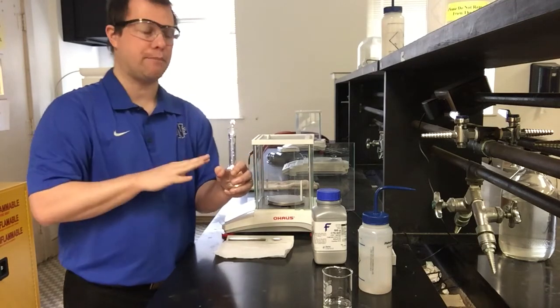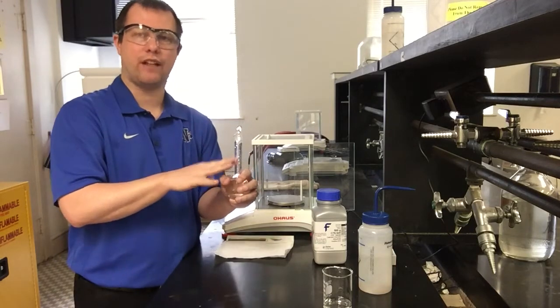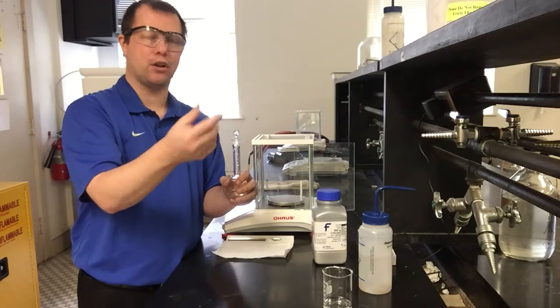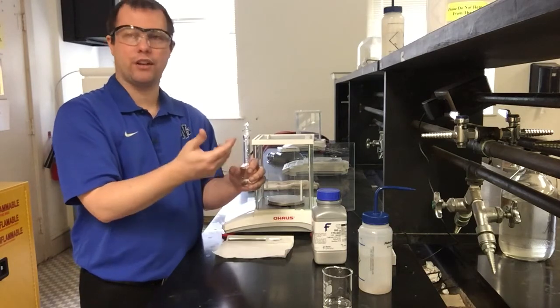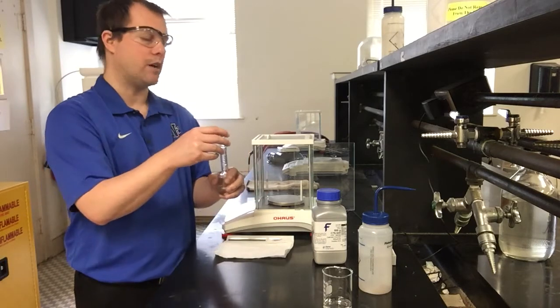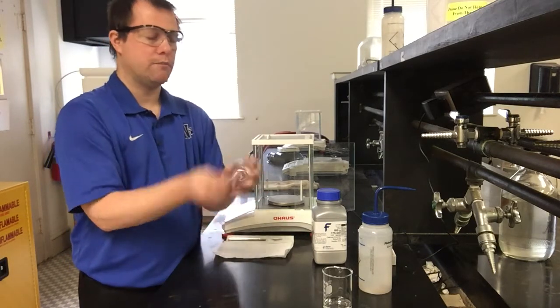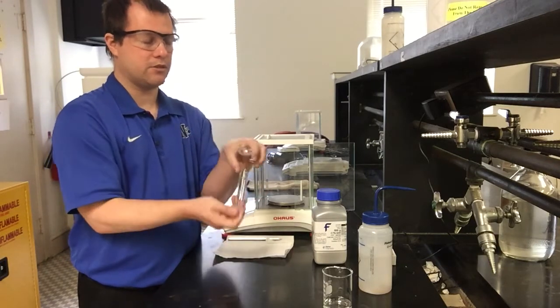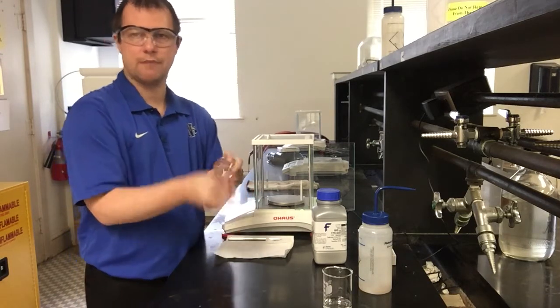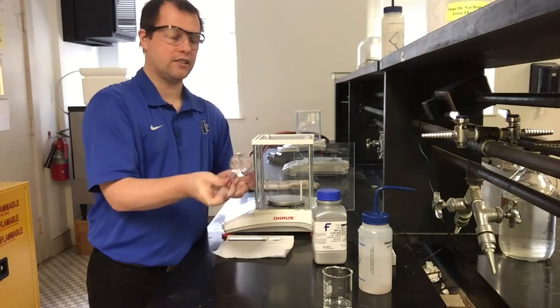Because sometimes, if you put all your contents in a closed flask like this, seal it and shake it up a lot, pressure can build up and might blow the top off. If you happen to be holding it upside down and it blows the top off, you just spill your stuff all over yourself and everywhere on the counter. That's what we're trying to avoid. So I mix it up, usually invert it a good few times, then vent it, and repeat that process a few times until I get my solution nicely, thoroughly mixed.